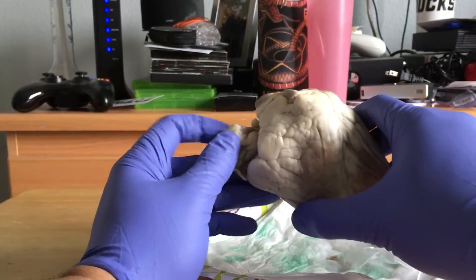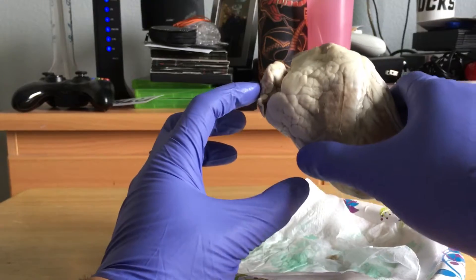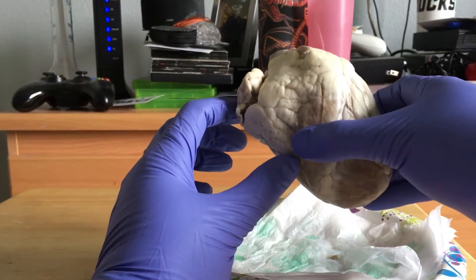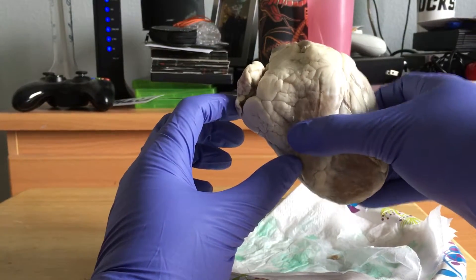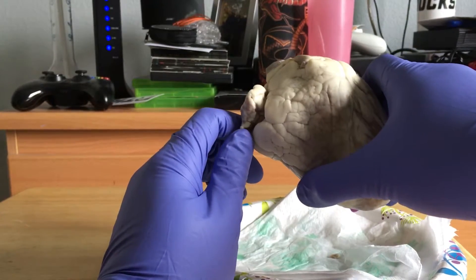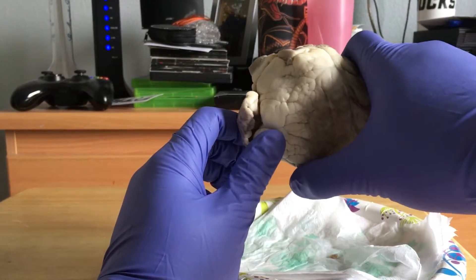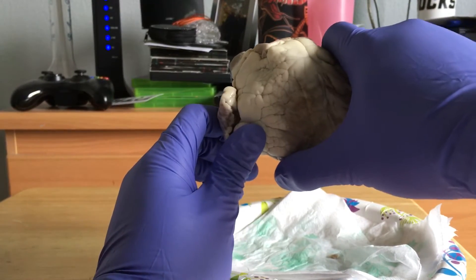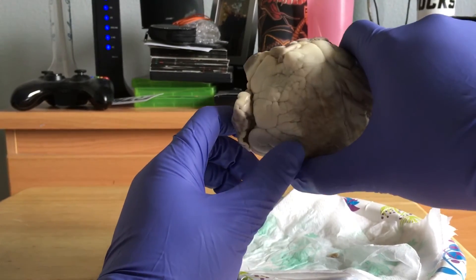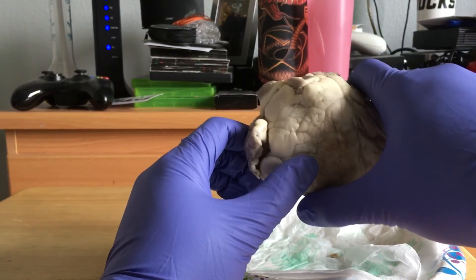Over here you would have the superior and inferior vena cava, as well as the coronary sinus. All of these are veins and they have deoxygenated blood, and the chamber that those would be going into would be the right atrium.